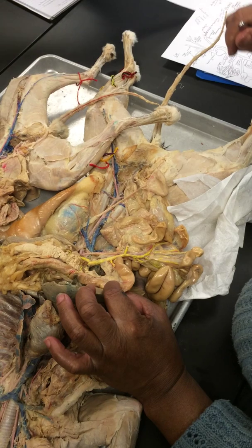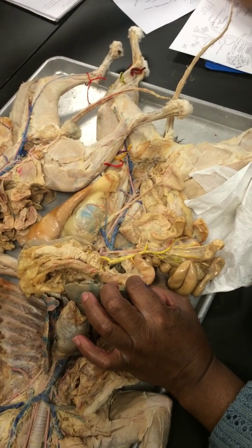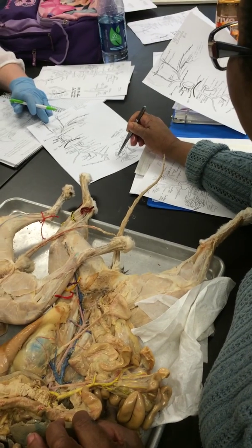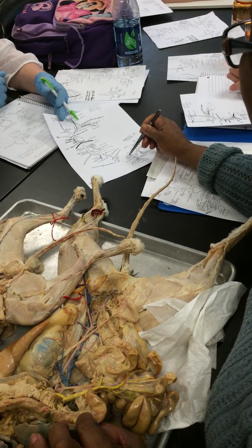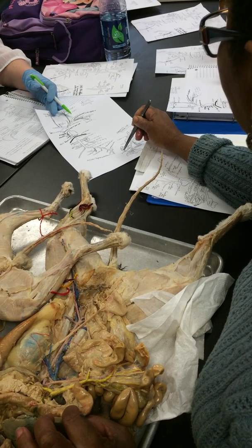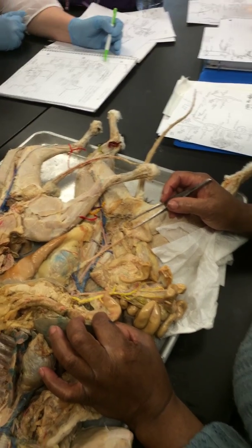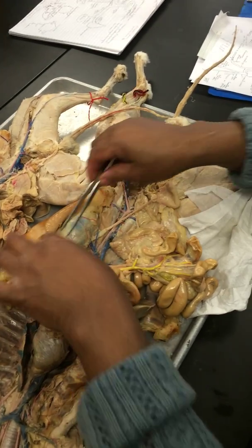Yes, there's that one. Is this, I guess, the superior mesentery as well? Yeah, this whole thing. So here's the duodenum part, and there's the pancreatico. You have a top one and a bottom one. This is kind of misleading because the top one should have been going to the hepatic portal directly, and the bottom one should be emptying down here, like this. The better diagram is this one. All right, but those are tiny, so let's move along.